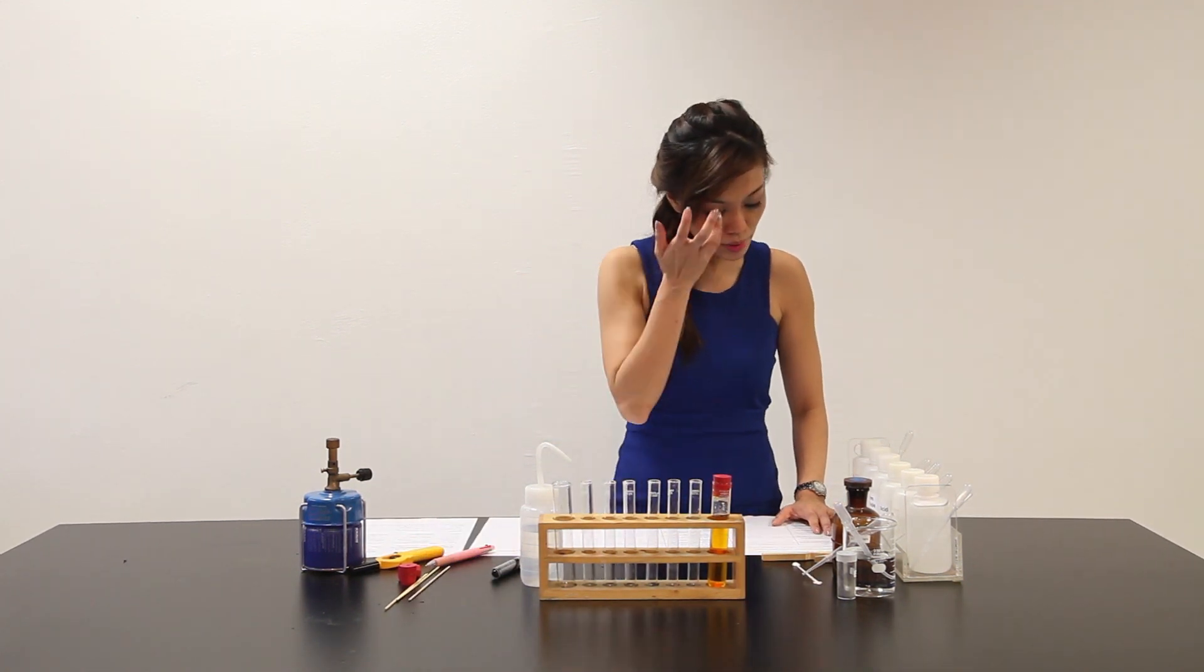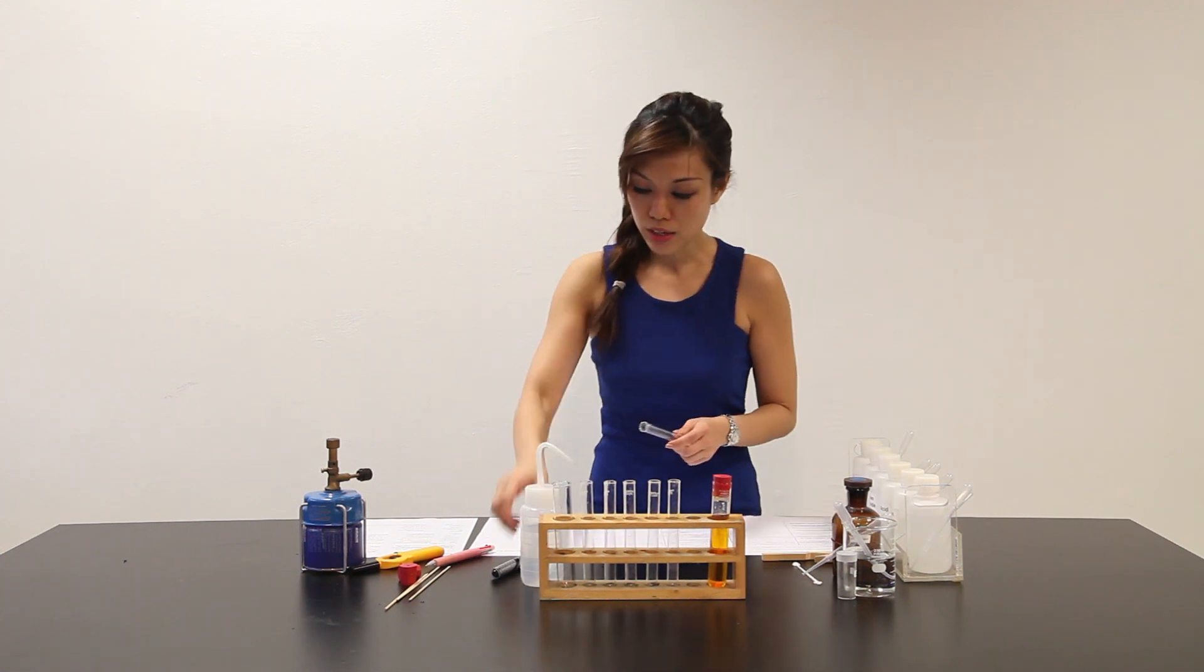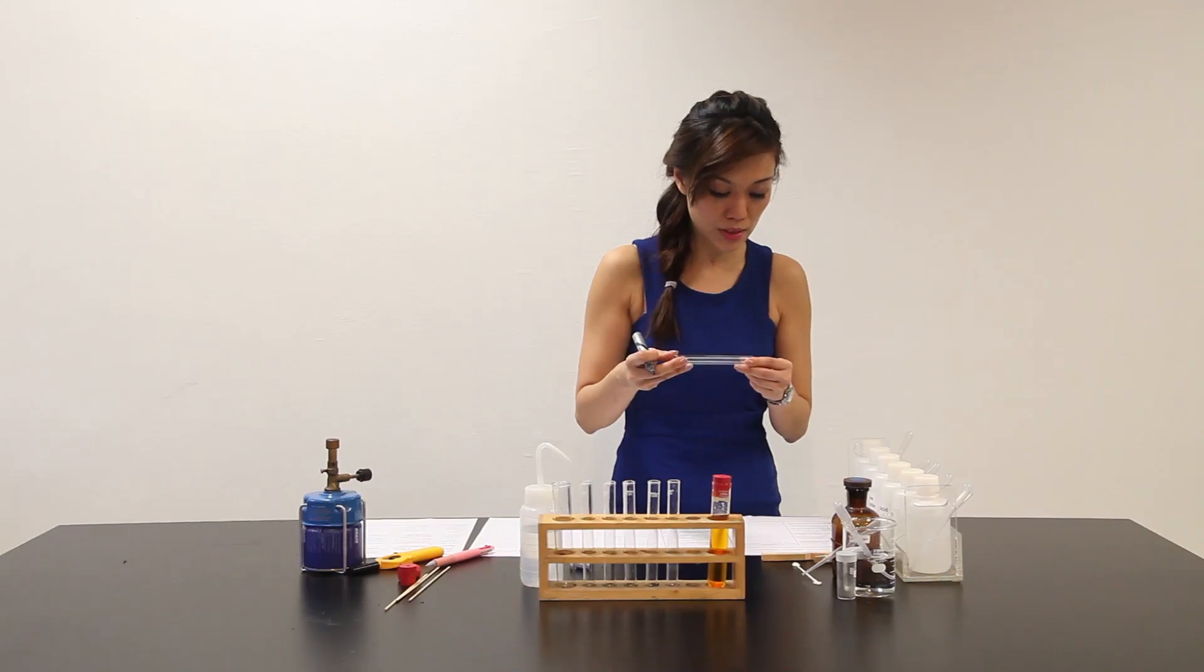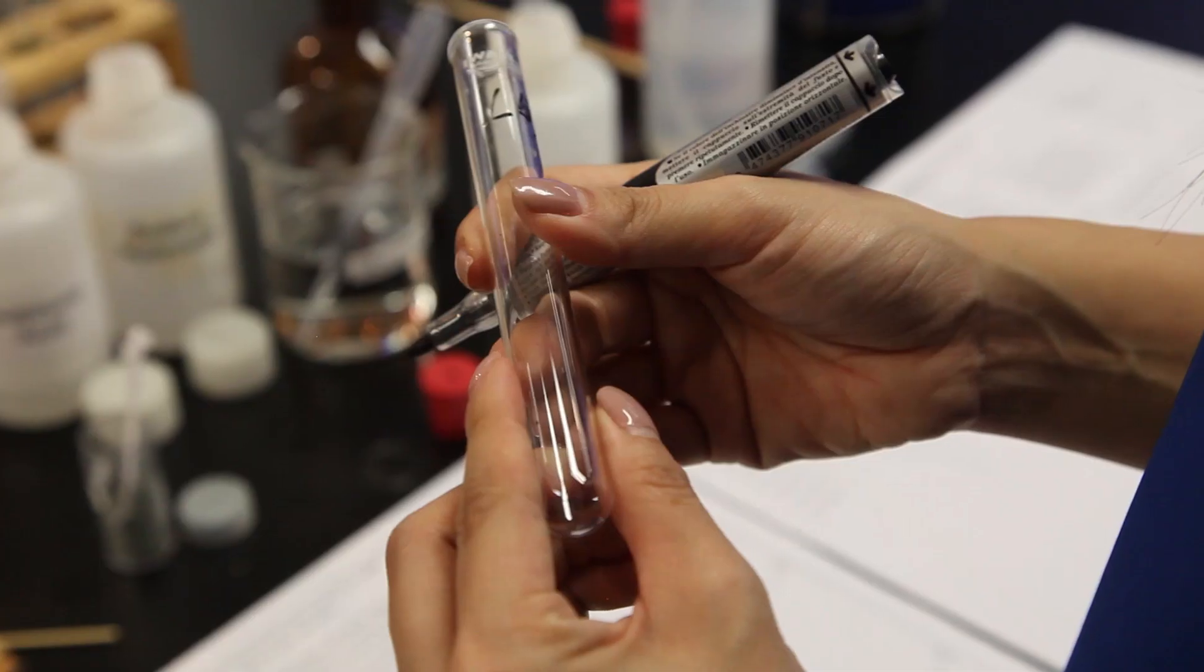It says place about 4 cm³ of the solution from part A. So let me use a marker. This is part B. 4 cm³. This is 2. Let me do an estimation of 4.